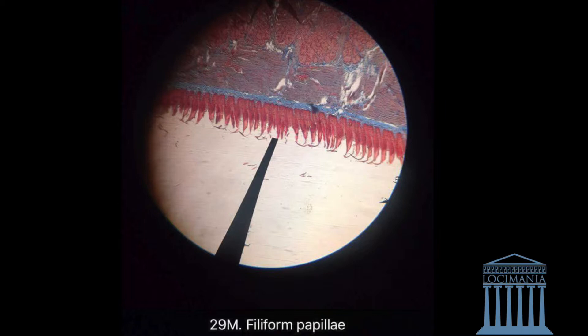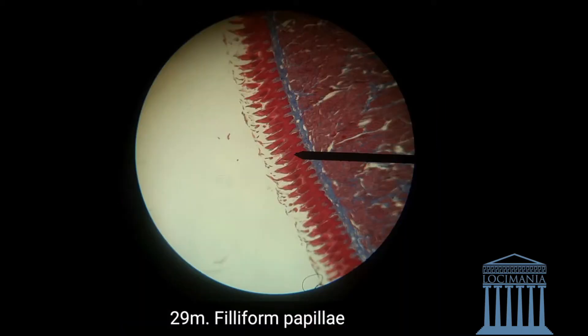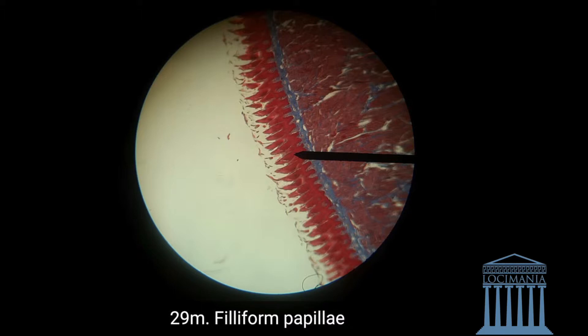Next we have the connective tissue. But before going on to that, I want to show you another specimen of the filiform papillae — it's really distinguishable and you cannot miss it. This is the filiform papillae, and the blue base there is the connective tissue.